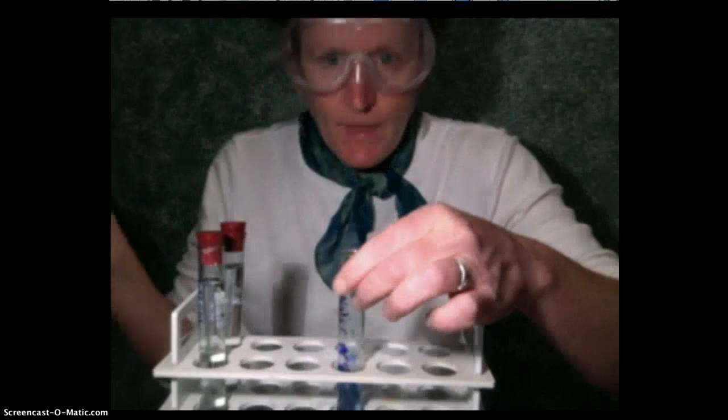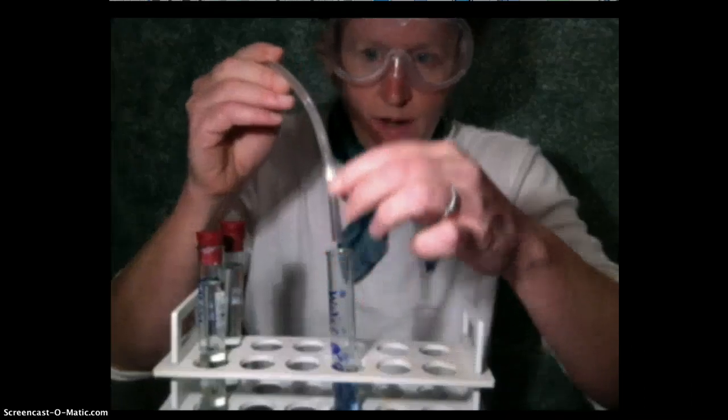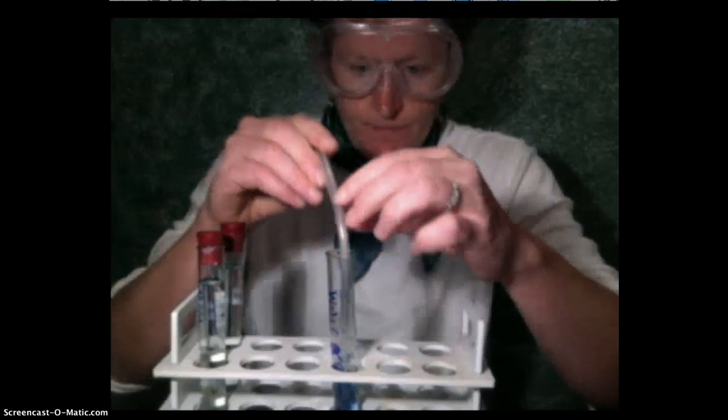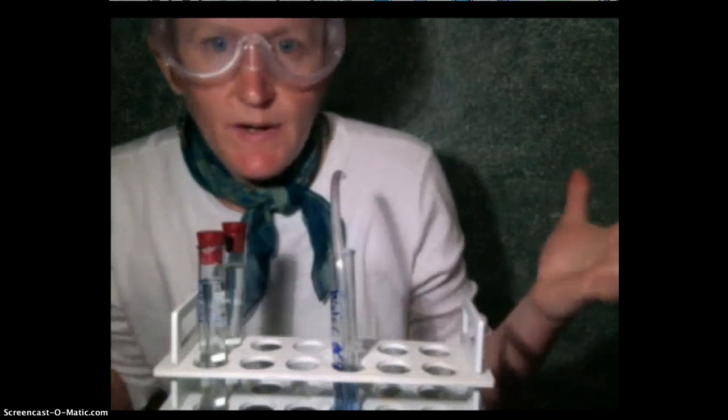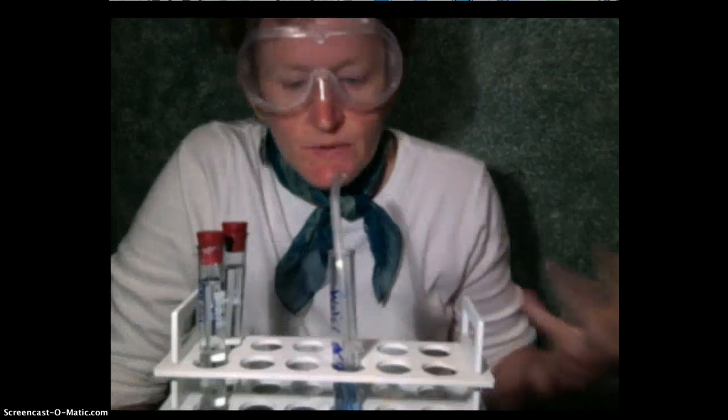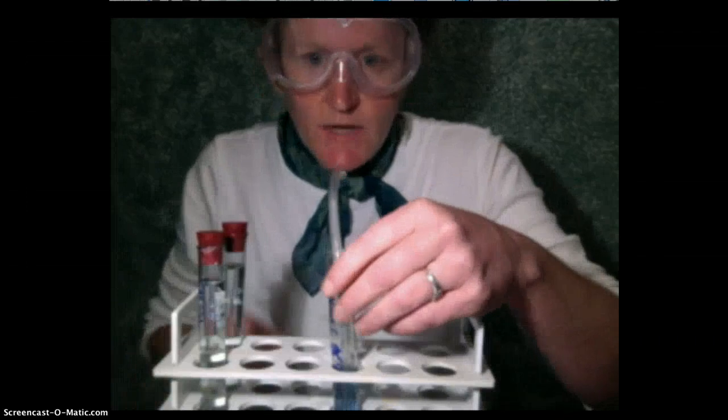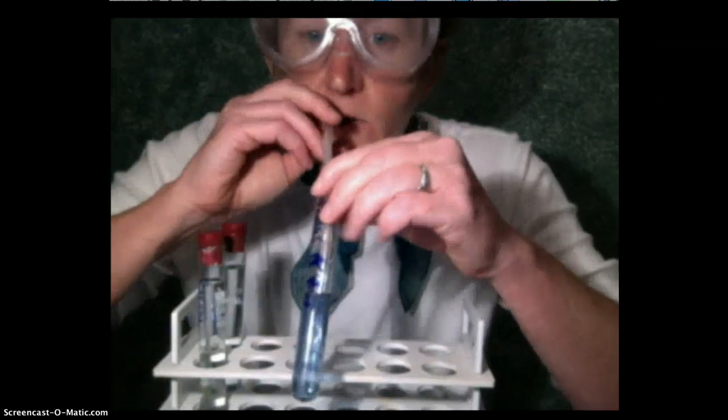Now this is just plain tap water and it's not acid, but I can make it acid by using my breath. I can blow in carbon dioxide because I respire as an animal. I use respiration to break down glucose into ATP and I produce carbon dioxide. When I blow that carbon dioxide into water, it turns into carbonic acid and changes the pH. So watch closely.